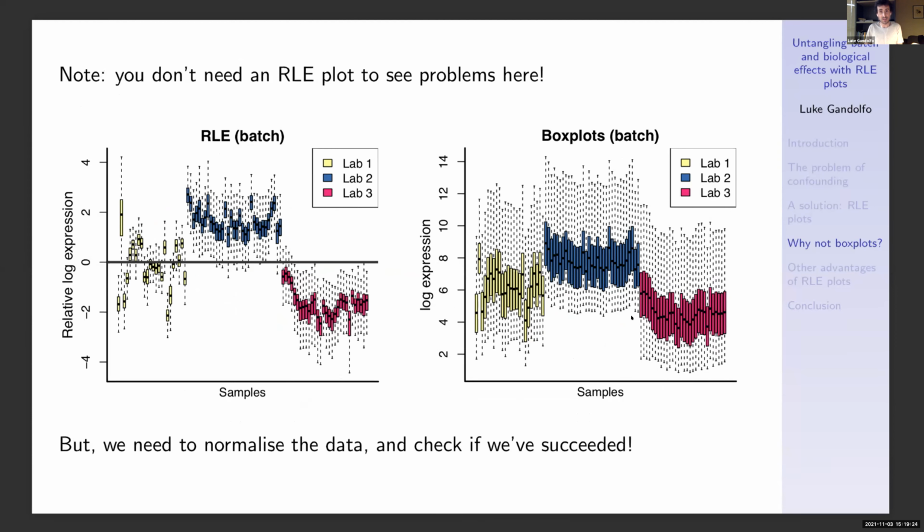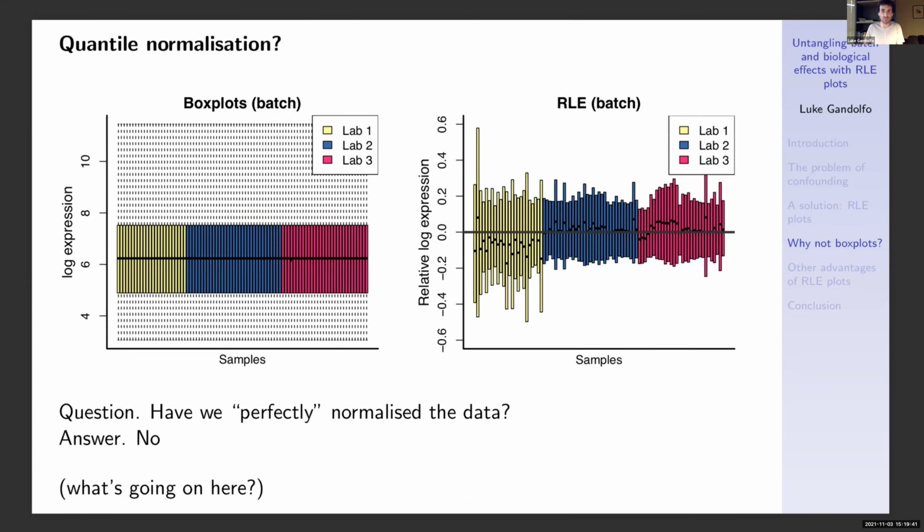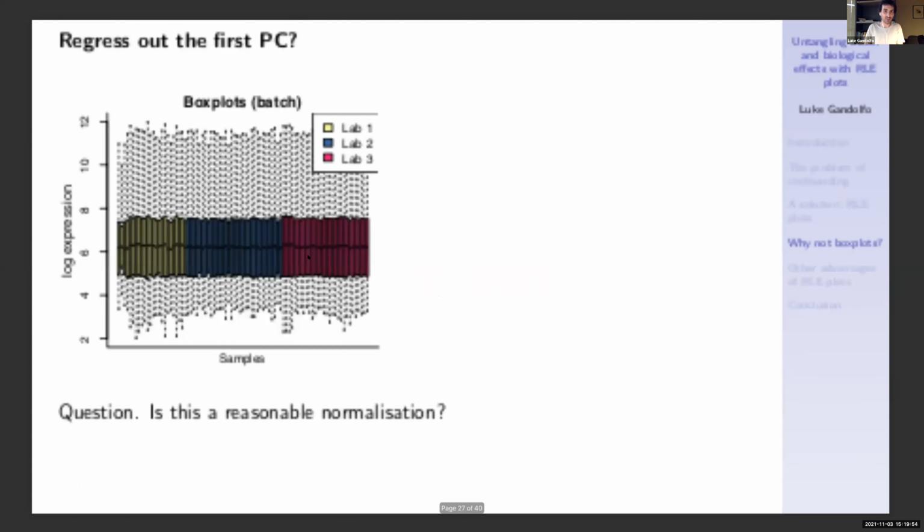And with a data set this bad, we need to check if we've succeeded. Well, why don't we try quantile normalization? Well, if we do box plots after quantile normalization, it looks, well, perfect, right? But have we perfectly normalized the data here? An RLE plot shows that we certainly haven't. There's still significant batch effects here. And in case you're wondering what's going on here, why does this look perfect? We can chat about that in question time.